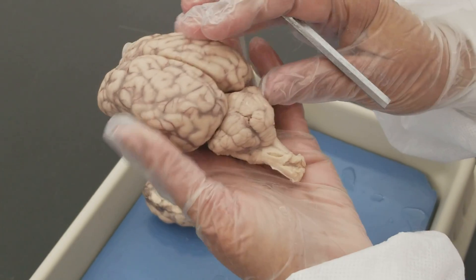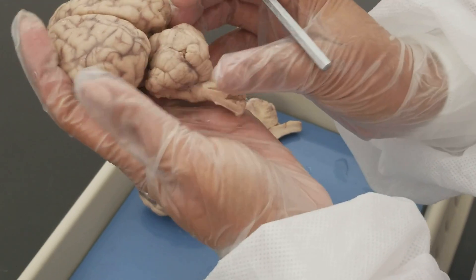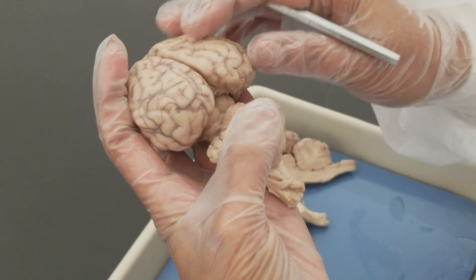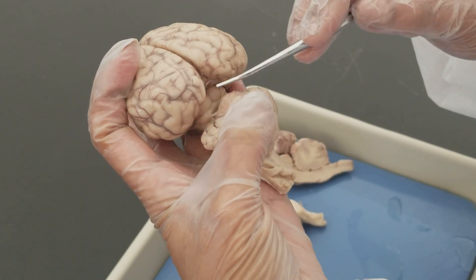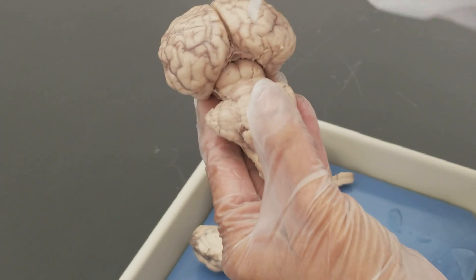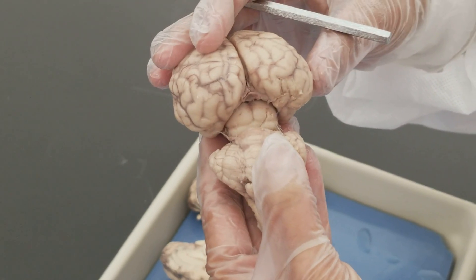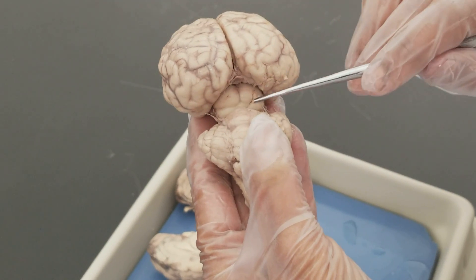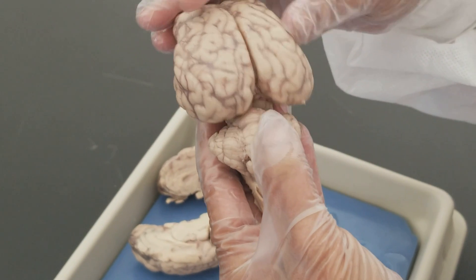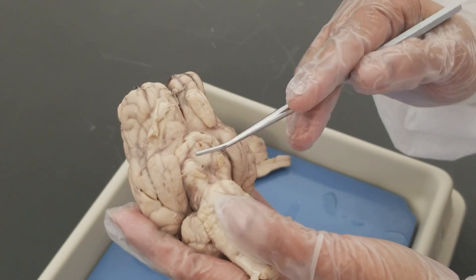From the superior view, if I separate the cerebellum a little from the cerebrum, you can see another part of the mesencephalon. There are two big bumps called the two superior colliculi, and also two smaller protrusions called the two inferior colliculi. All four of these together are called the corpora quadrigemina. In the inferior view you saw the cerebral peduncles.